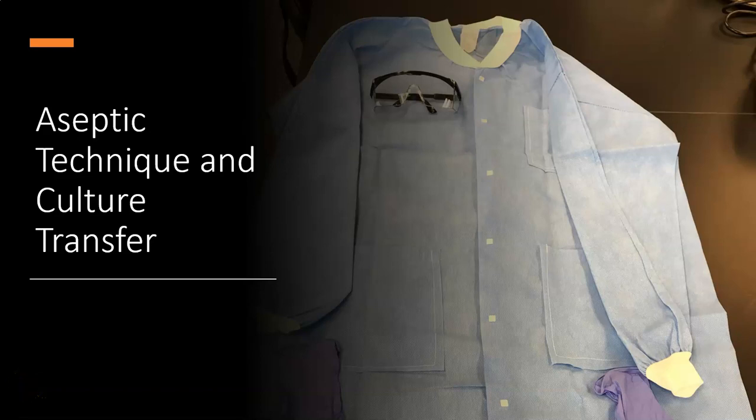Aseptic techniques are performed in microbiology and general science labs all around the world. They help keep scientists, researchers, interns, and technicians healthy and safe, and they prevent contamination of experiments, which can lead to faulty results. In this video, we're going to talk about aseptic techniques, and we'll look at some common ones that are used in the microbiology lab.